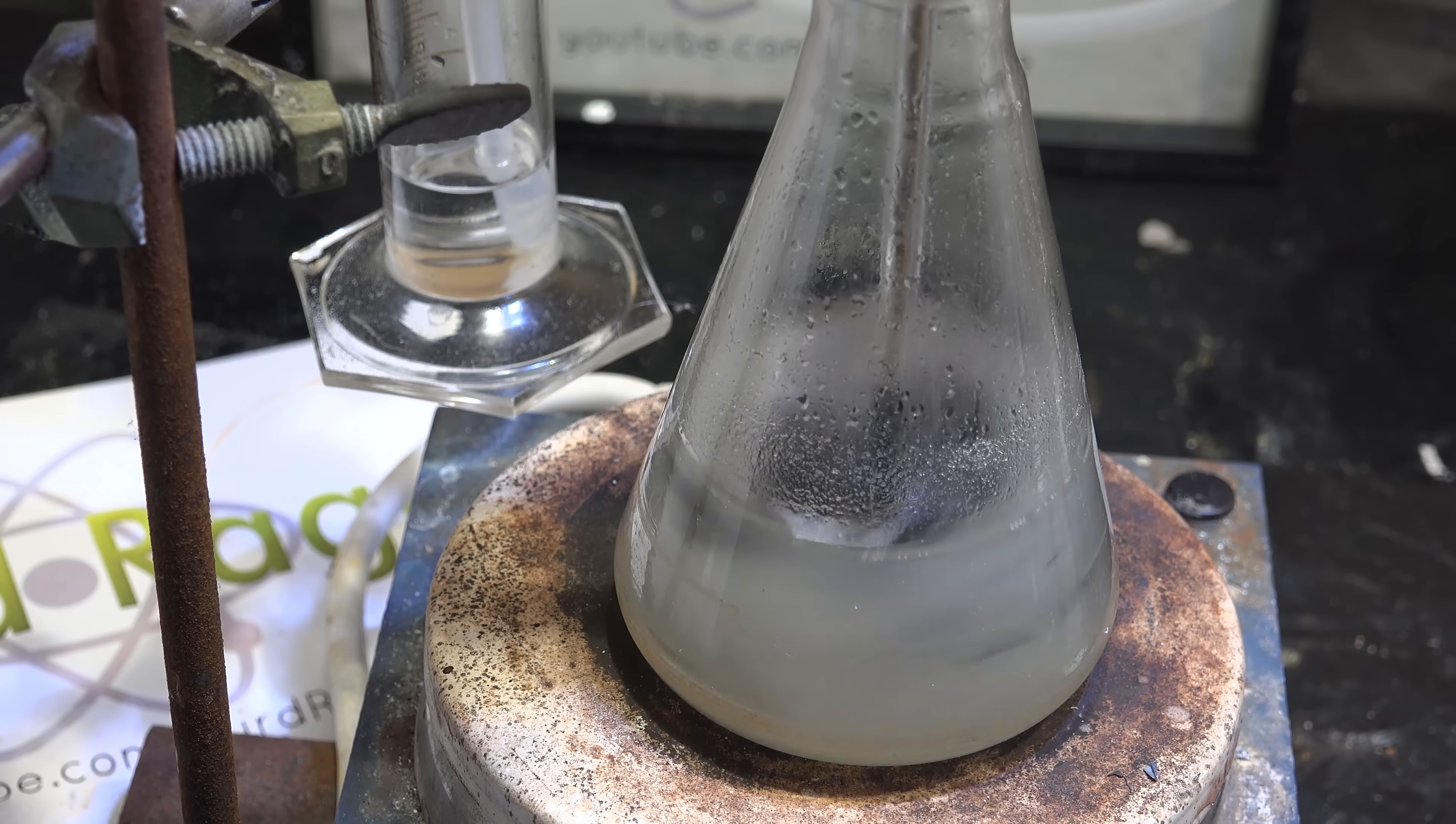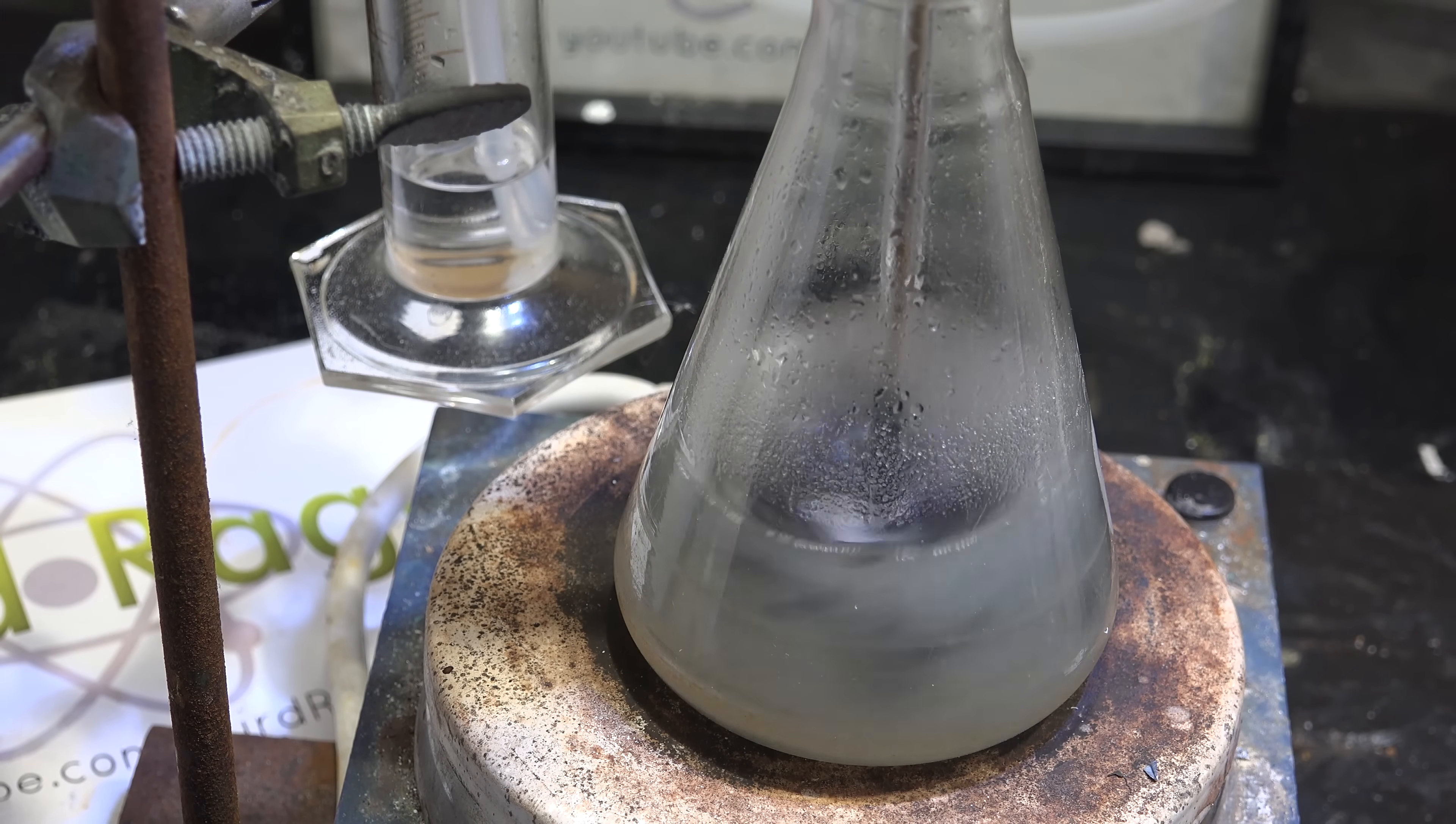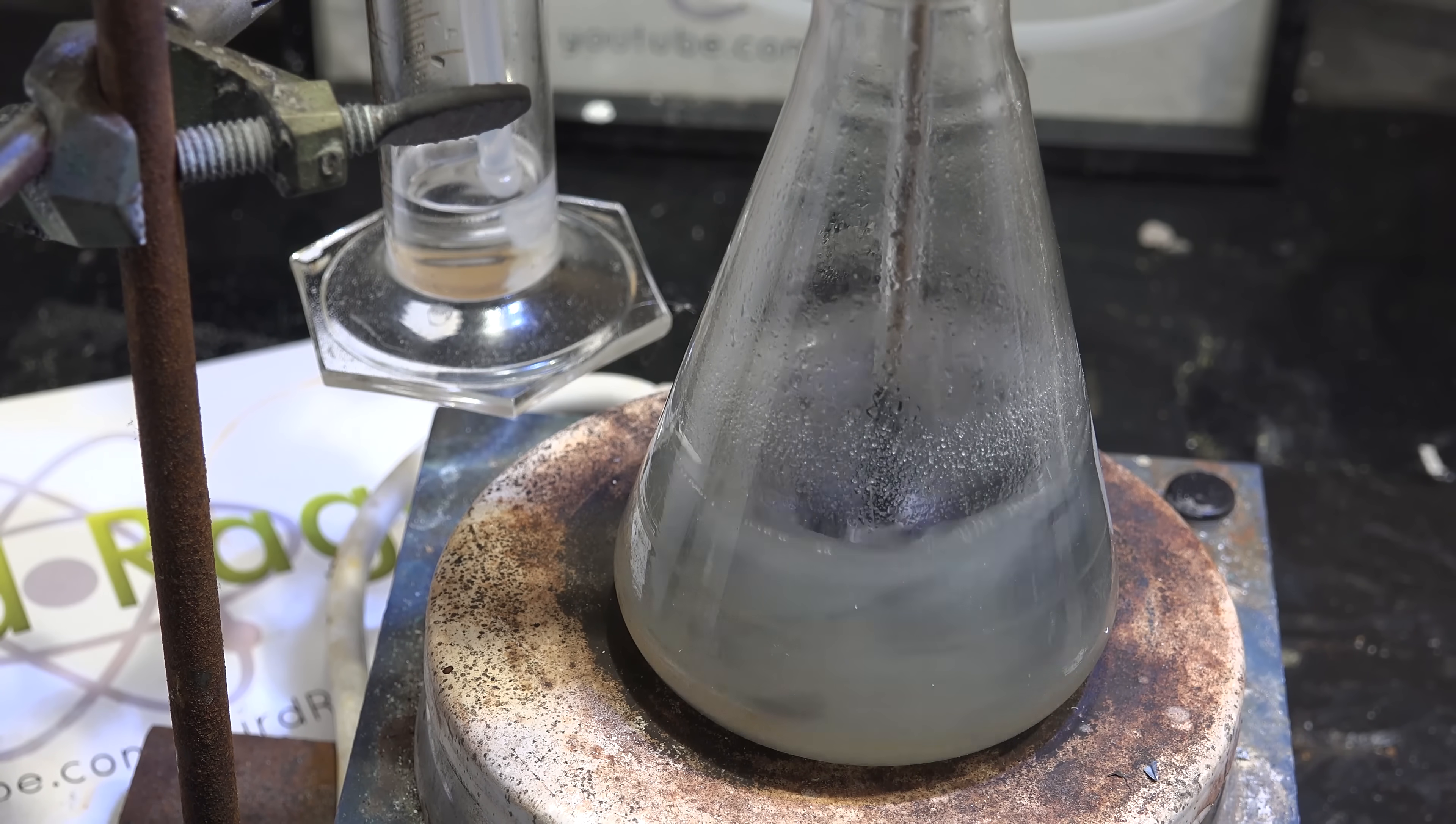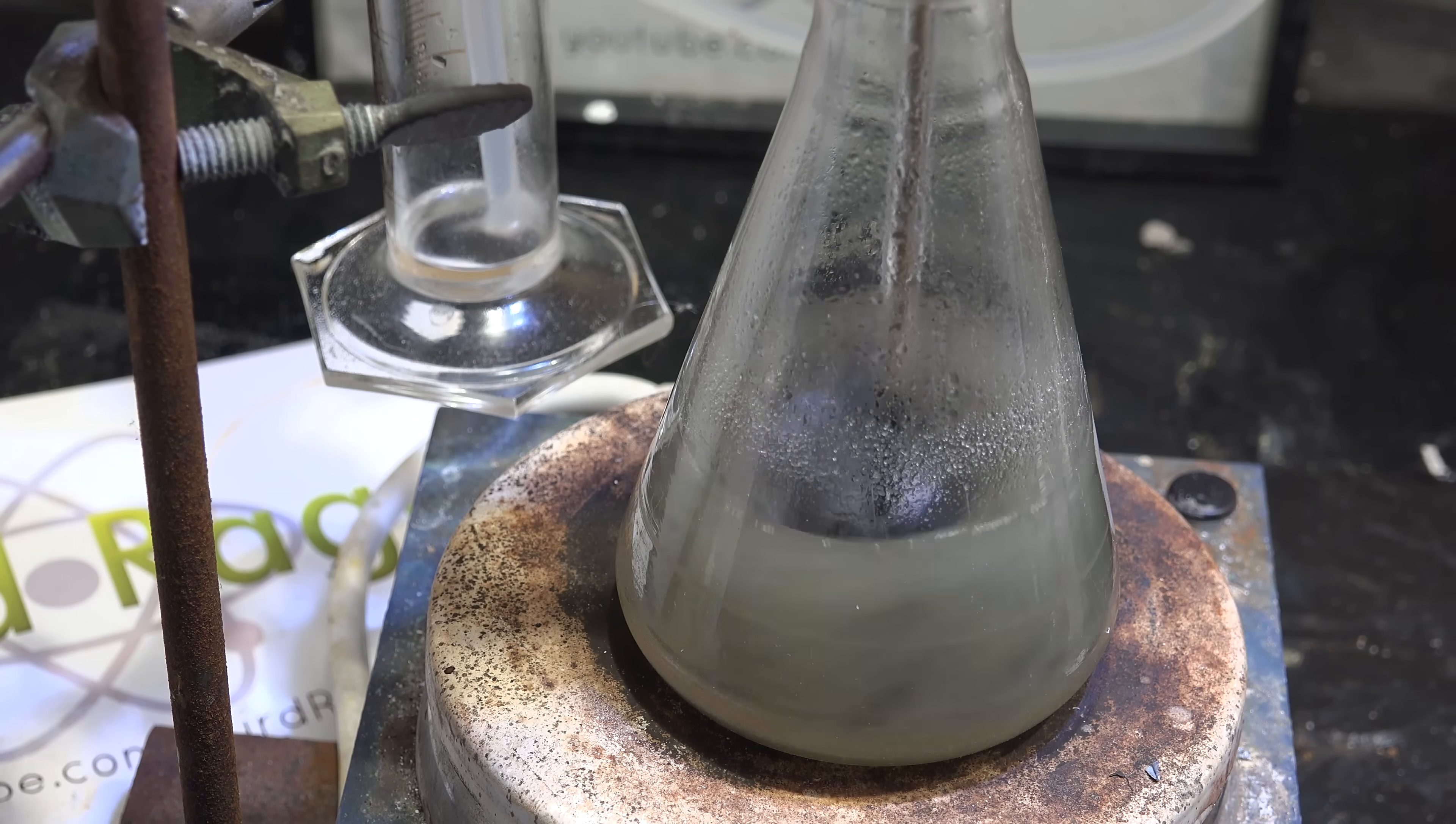Indeed the lithium broke up over time and the bubbling indicates a reaction is happening. Probably water being consumed as tiny amounts of water are soluble in mineral oil. But as time progressed the bubbling stopped, and if you look closely at the bubbler now, it's back flowing. So what's happening is the lithium is reacting with the hydrogen, oxygen and nitrogen in the flask and creating a vacuum. The lithium is so starved to react with something that it's eating the air and waste products from the previous reaction. Poor lithium. And still there was no sodium.